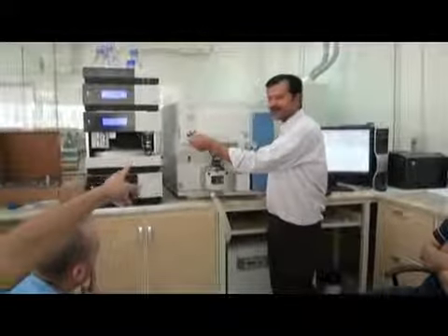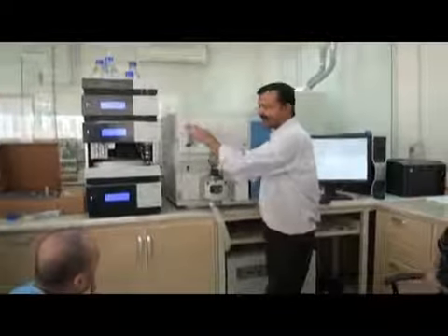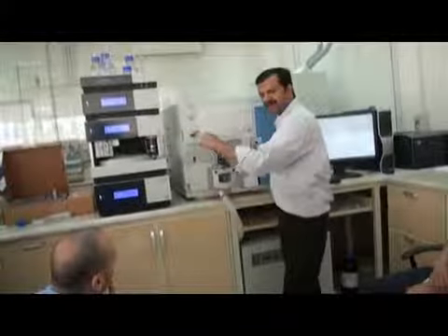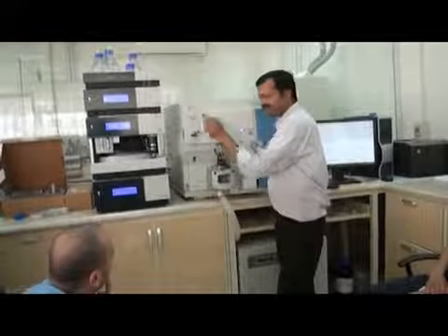We have a loop, inject or load. It will be on load position. You inject from here. The loop will be filled. The liquid is coming from here. Only the mobile phase will come from here. You press inject and it will come.